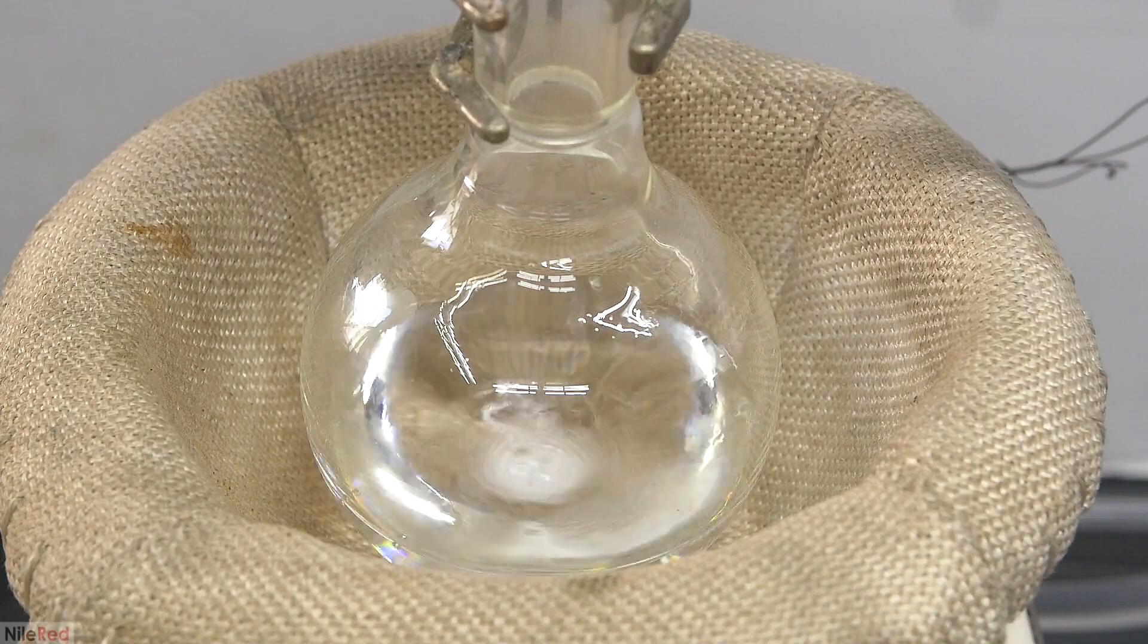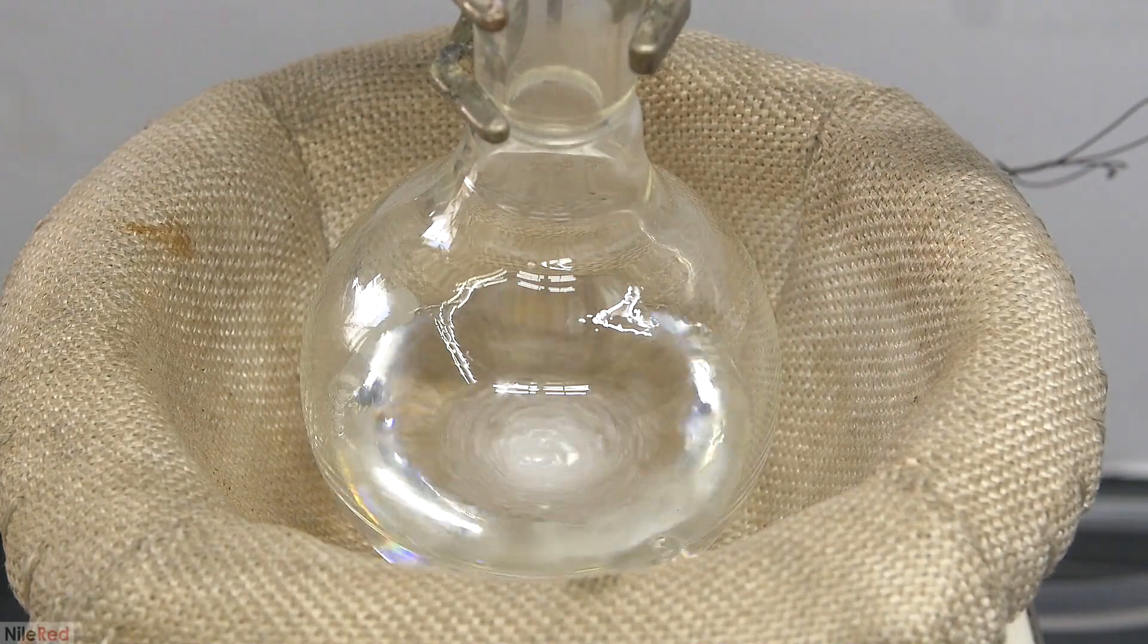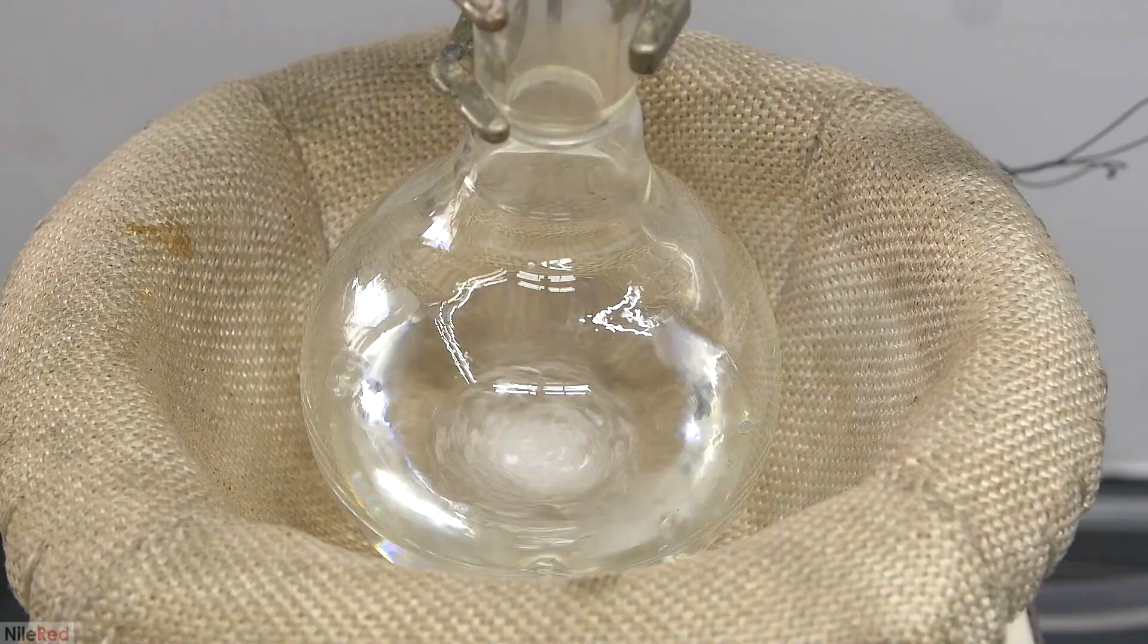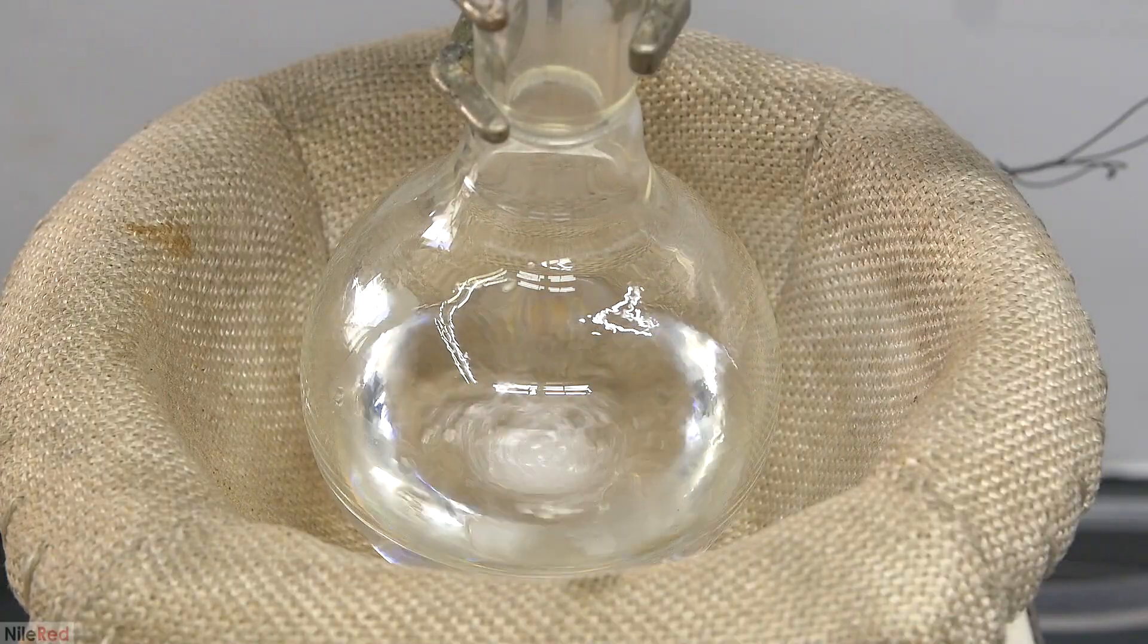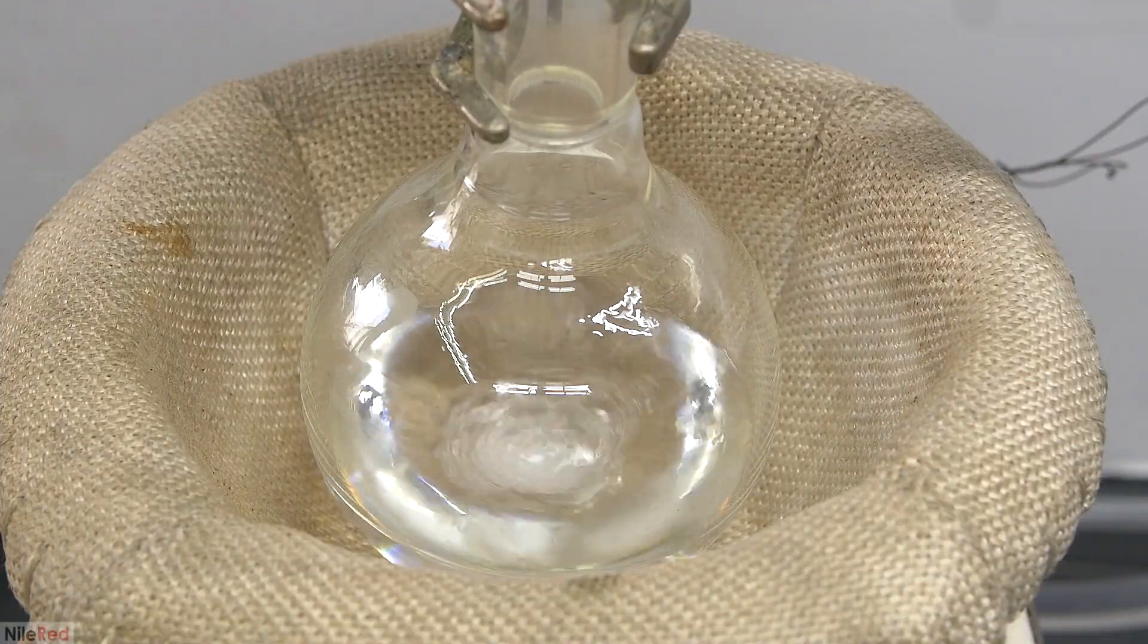So the bubbles coming off are either gas that was dissolved into the benzaldehyde, or some low boiling point solvents. In any case, whatever came off just went right through the system, and nothing collected in the receiving flask.